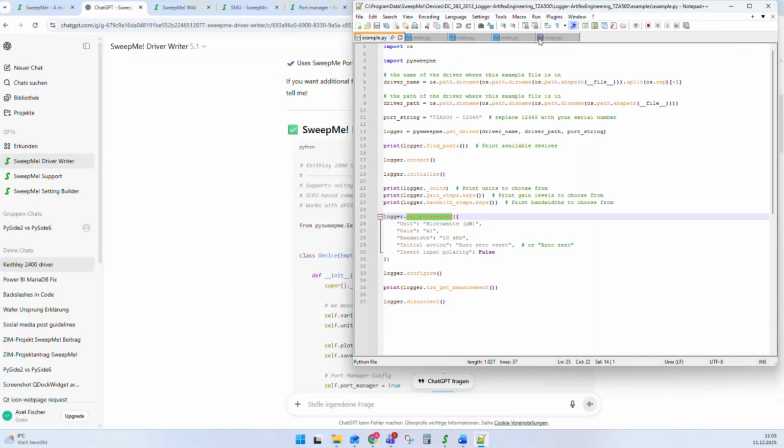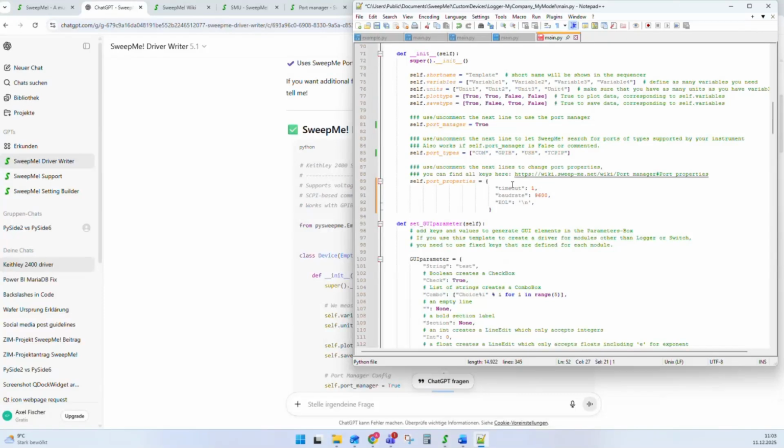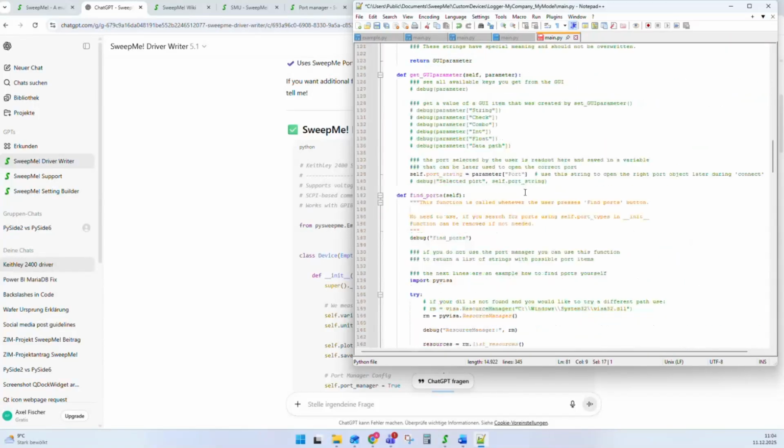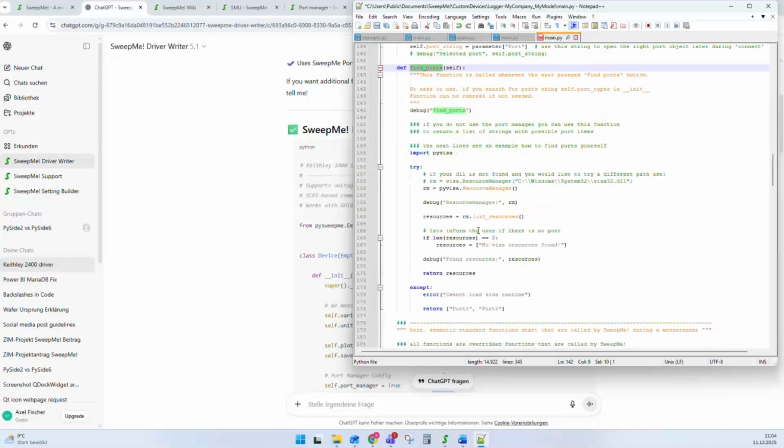As a last point that I forgot, regarding the port management. Sorry, I have to go back to a point that I was already speaking about. When I said that you have this port management, sometimes you cannot use our port manager because you need to find your ports on your own from your own library. And in this case, there is a function find ports. And if you use find ports, you can completely take care of the port management and return a list of port strings that you can use later on to open your port and connect. So this is one thing that I forgot to mention.